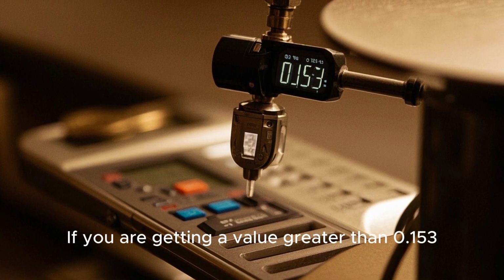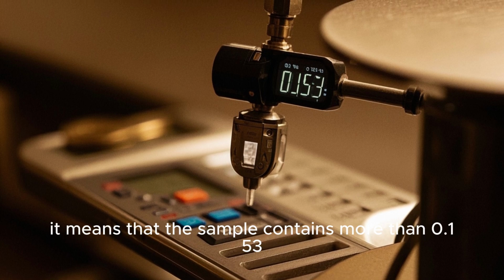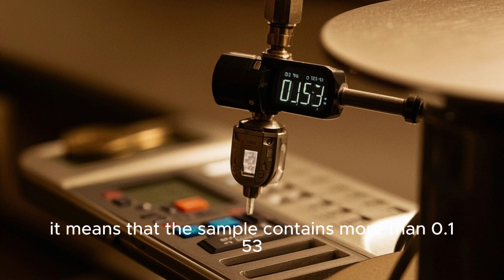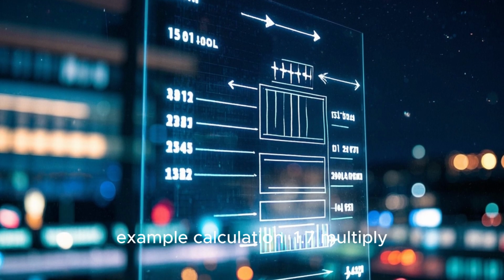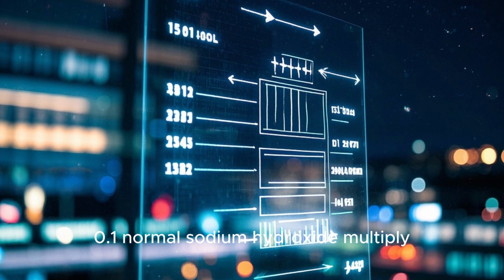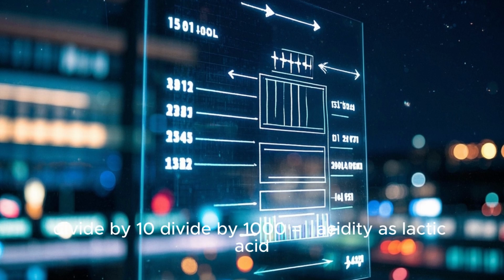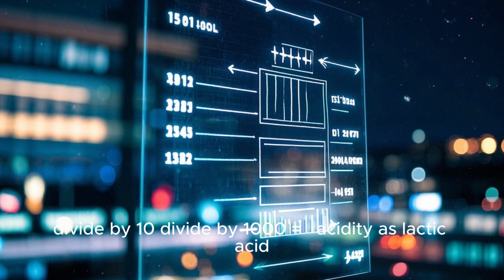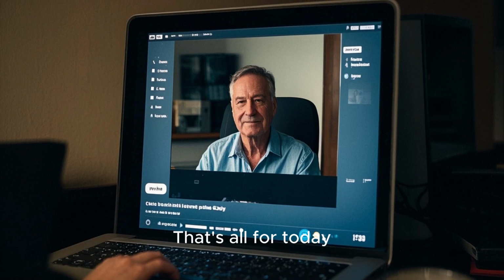If you are getting a value greater than 0.153%, it means that the sample contains more than 0.153% of lactic acid. Example calculation: 1.7 multiply 0.1 normal sodium hydroxide, multiply 90.08, multiply 100, divide by 10, divide by 1000, equals percent acidity as lactic acid, 0.153%.